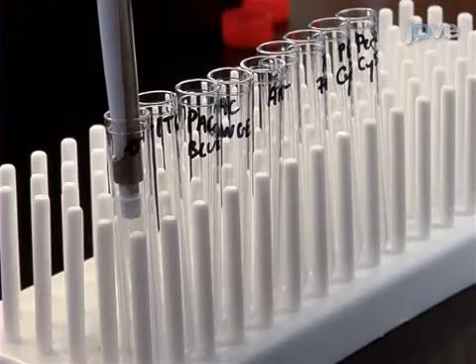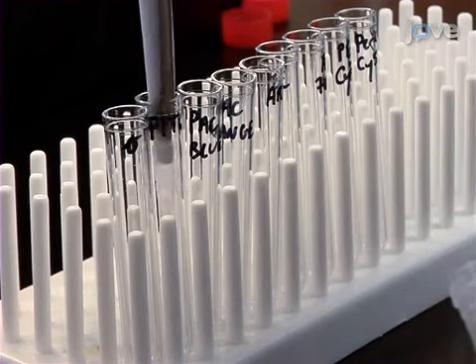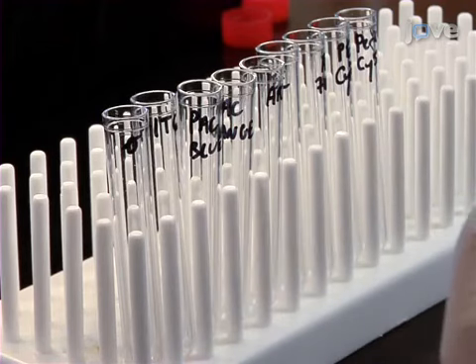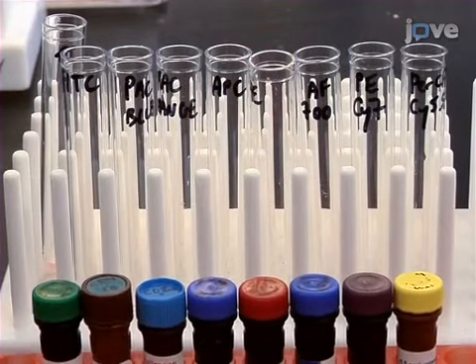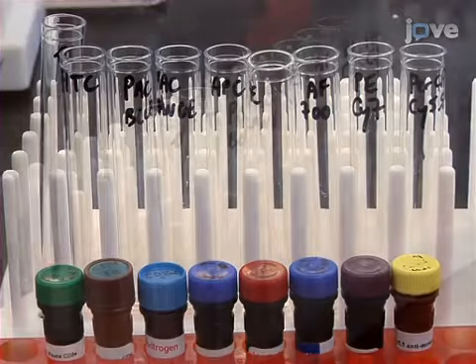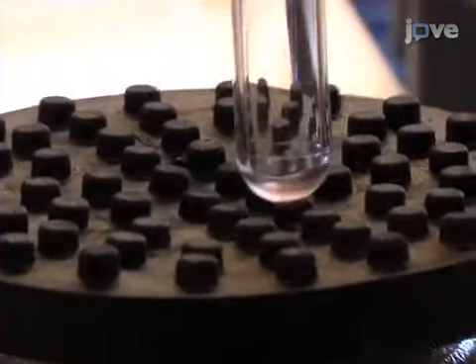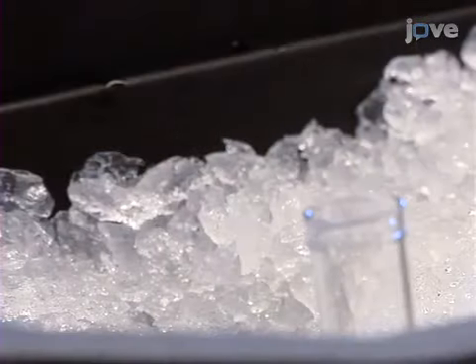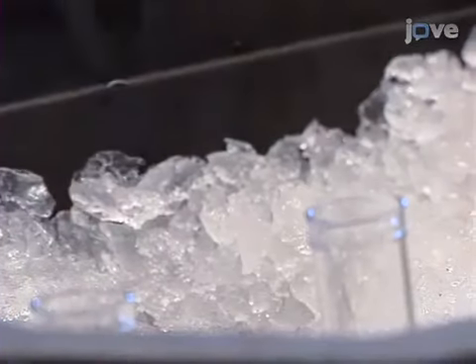For each fluorochrome to be used, mix 50 microliters of the leftover unbound fraction of cells in a 5 milliliter FACS tube with 1 microliter of anti-CD4 antibody conjugated to the appropriate fluorochrome. Set aside an unstained control as well. Next, vortex, and then incubate all of the samples at 4 degrees Celsius for 30 minutes.